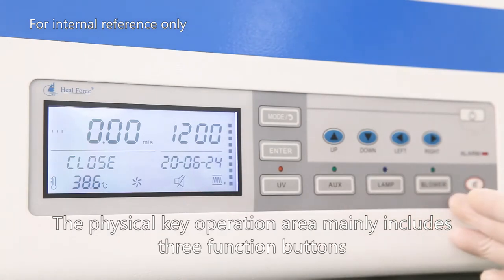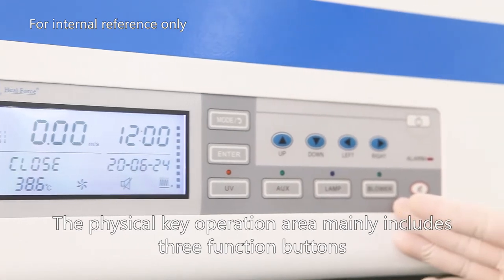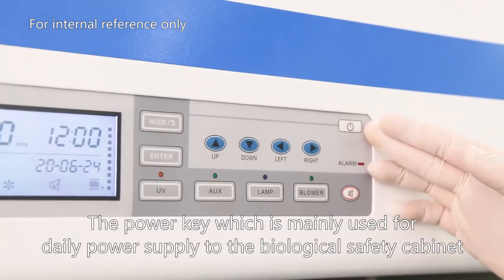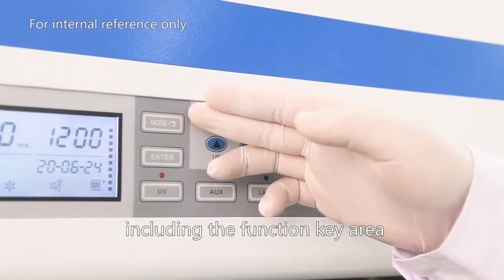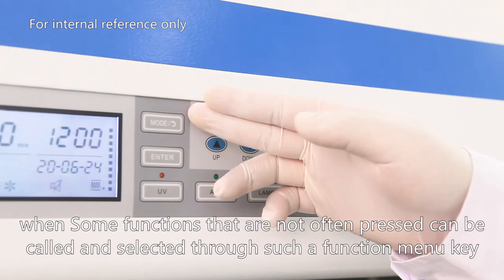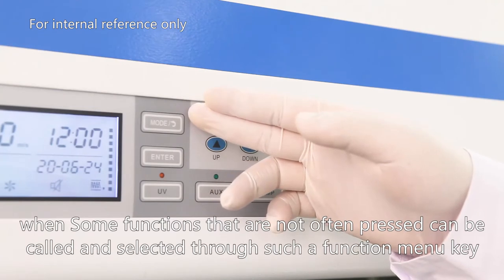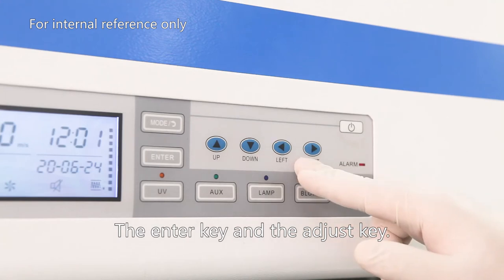The physical key operation area mainly includes three function buttons: the power key, which is mainly used for daily power supply to the biosafety cabinet, and the function key area, through which functions that are not often used can be called and selected via the function menu key, the enter key, and the adjust key.